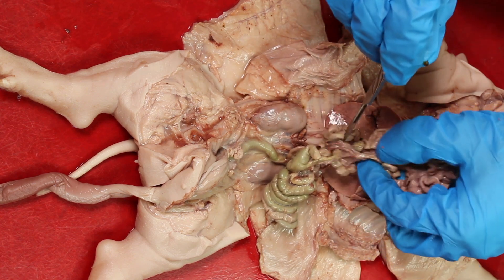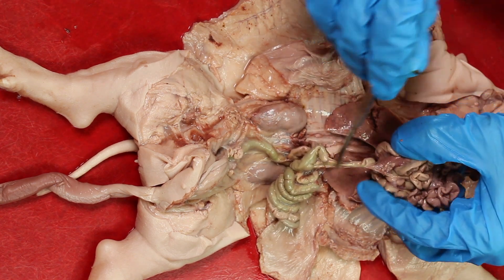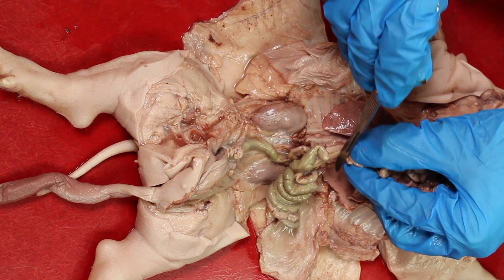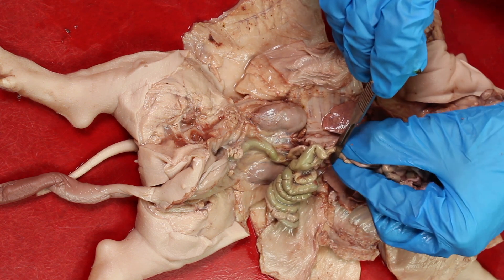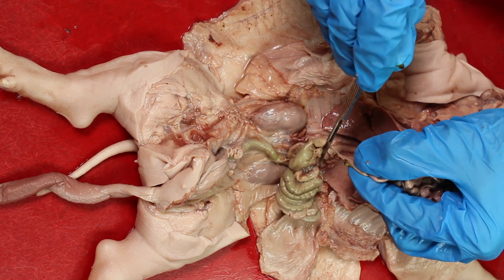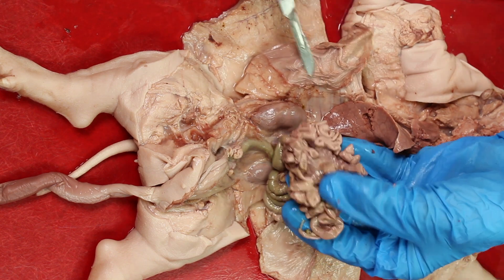We separate the small intestine from the colon, cutting just below the ileocecal junction, where the ileum of the small intestine joins the cecum of the colon.